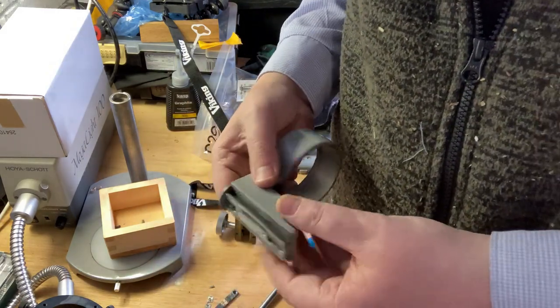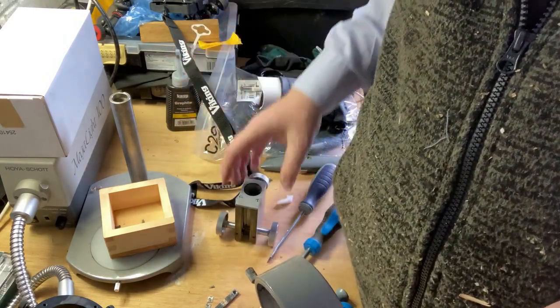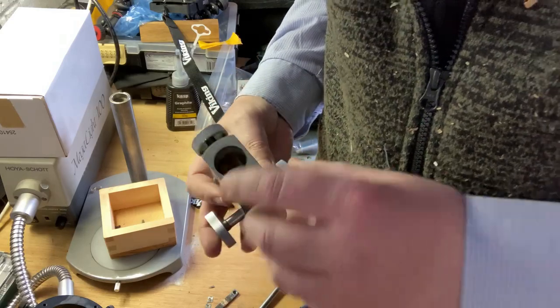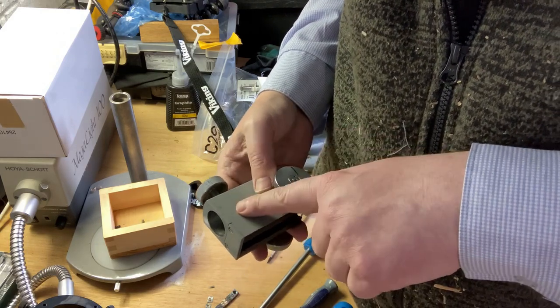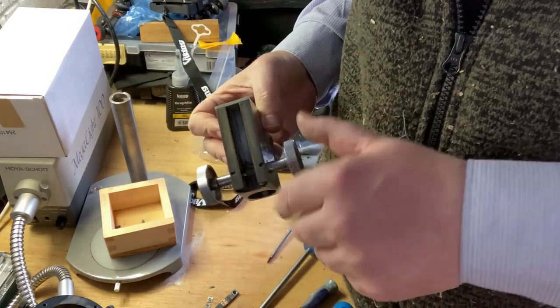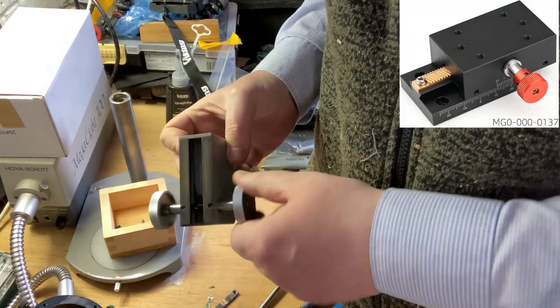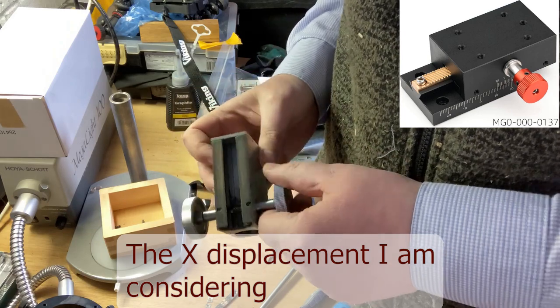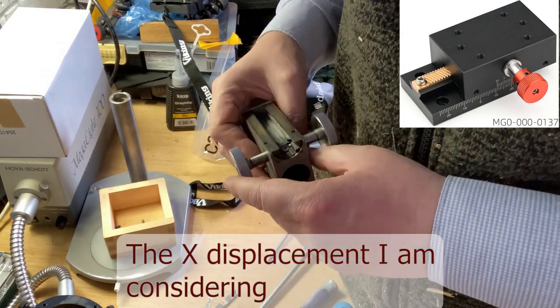So the part of me is sort of going, right, how do I make this back in operation? I'm going to need to have something to attach to this base here. There's going to be a displacement motor, which has a displacement mechanism, which is going to have a focus wheel like this. It's not going to be on both sides, but it's meant to be for X. I'm wondering if it will be strong enough to do it.